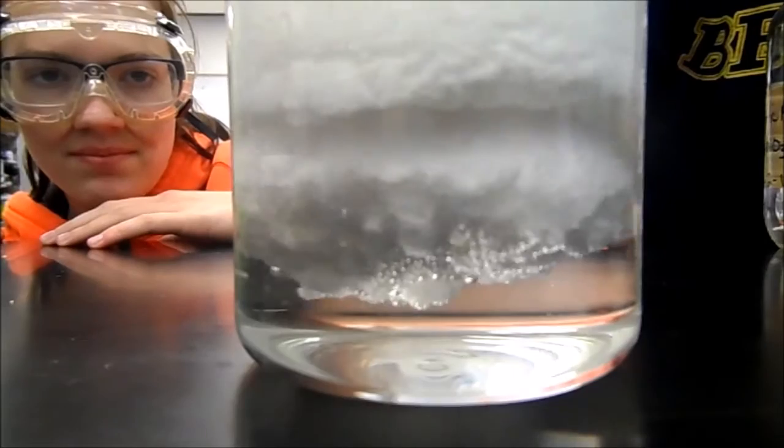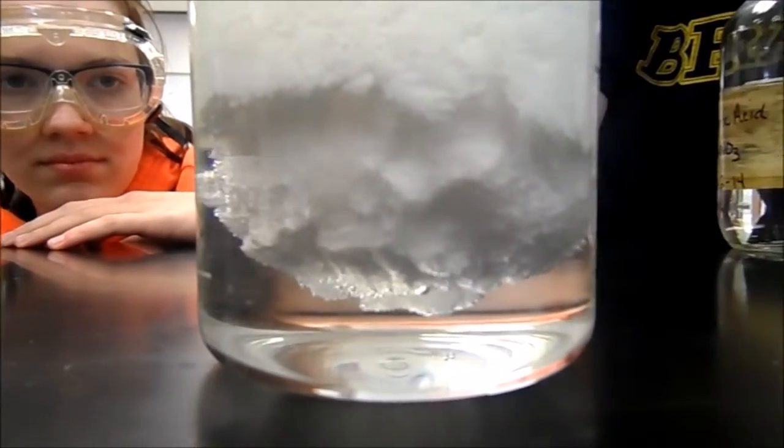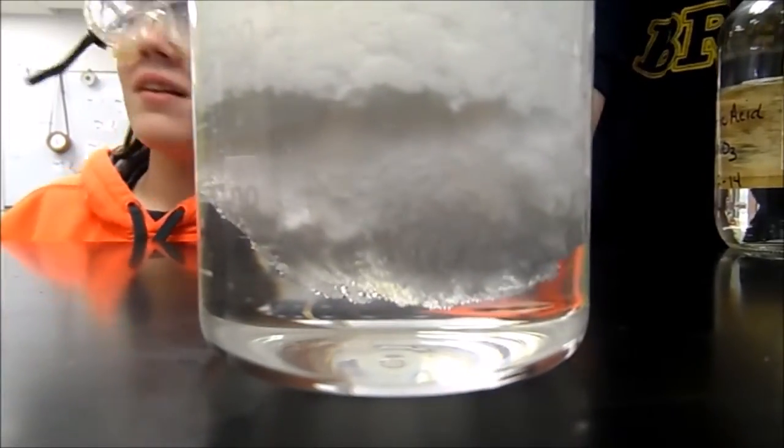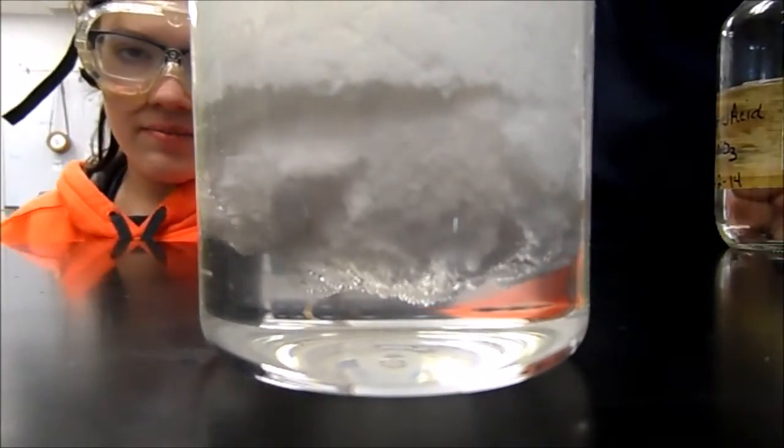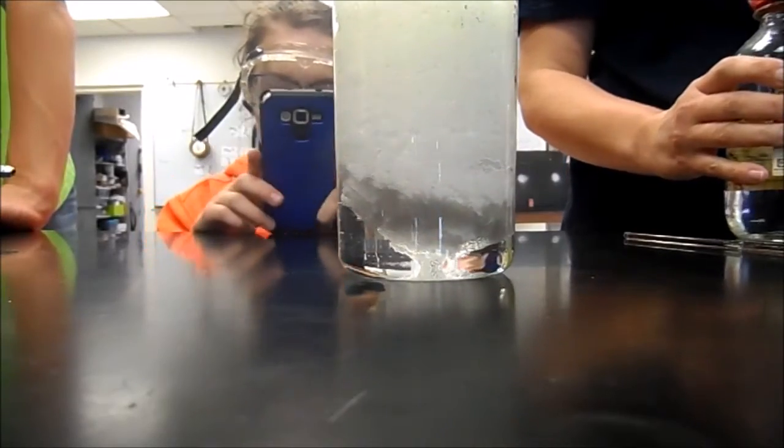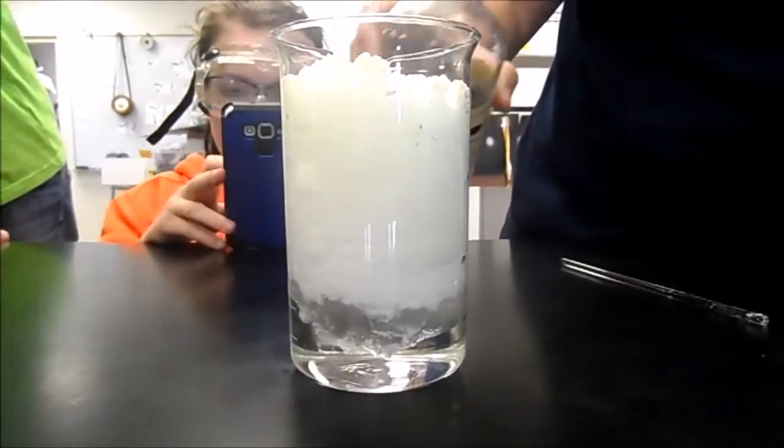Yeah, it's a cell and so the membrane, what will happen is the shell will come off and the membrane will still be in there. You can see the whole huge layer. Do you see it? So what we should not do is use a jumbo sized egg. Yeah, that's the only one. We're gonna add more, we'll add a little bit more.